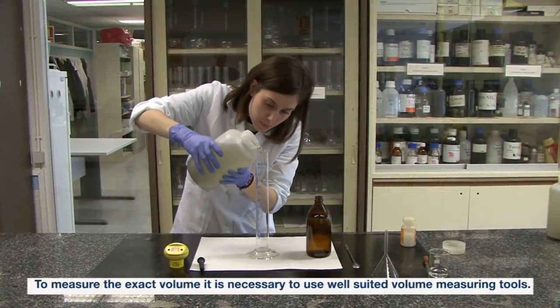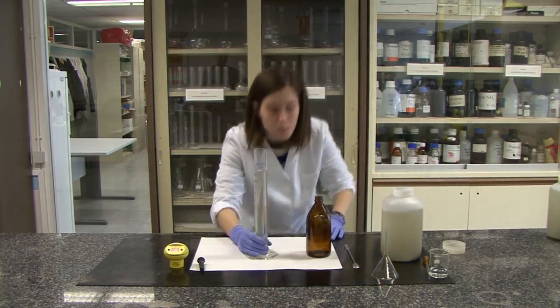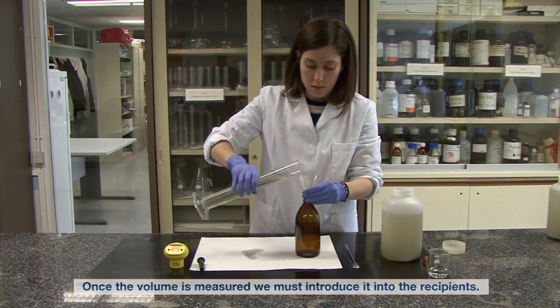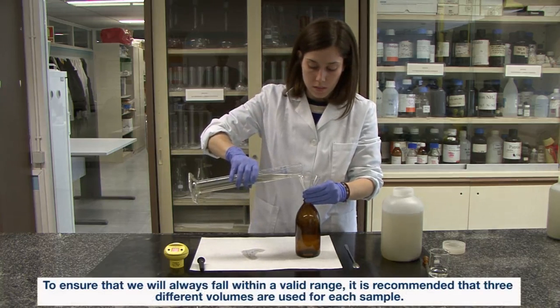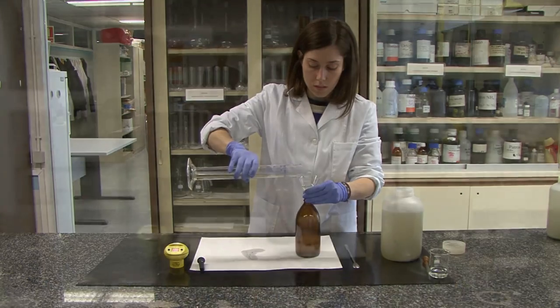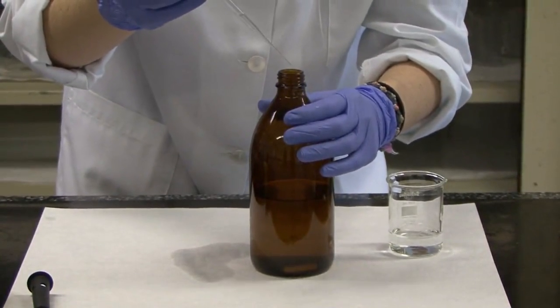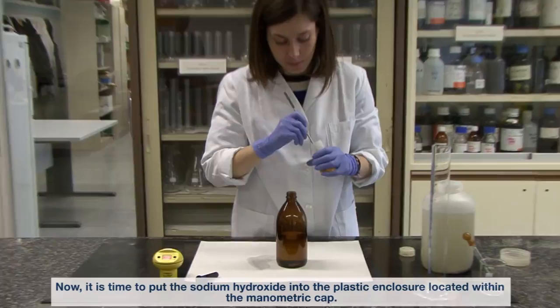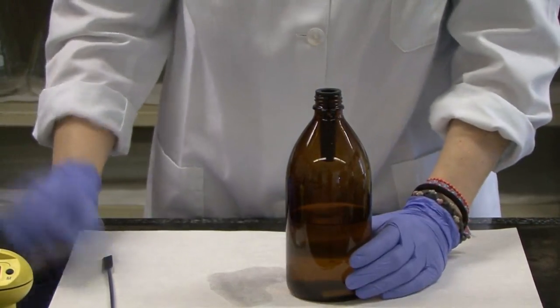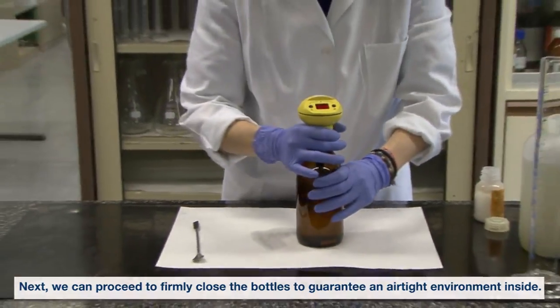To measure the exact volume, it is necessary to use well-suited volume measuring tools. Once the volume is measured, we must introduce it into the recipients. To ensure that we will always fall within a valid range, it is recommended that three different volumes are used for each sample. At this point, we will add the nitrification inhibitor. Now it is time to put the sodium hydroxide into the plastic enclosure located within the manometric cap.